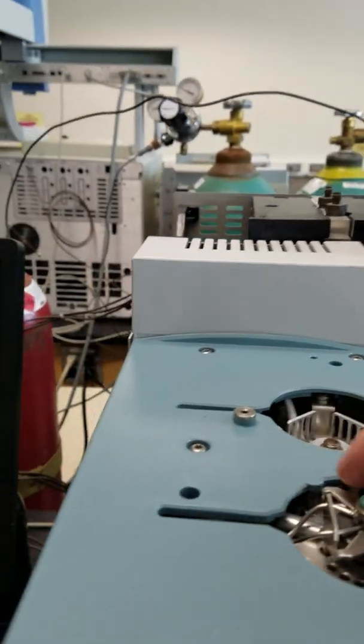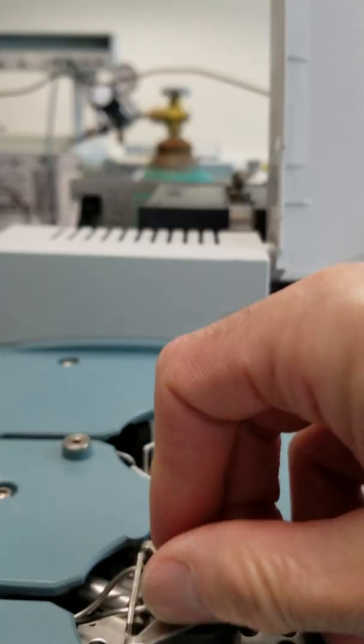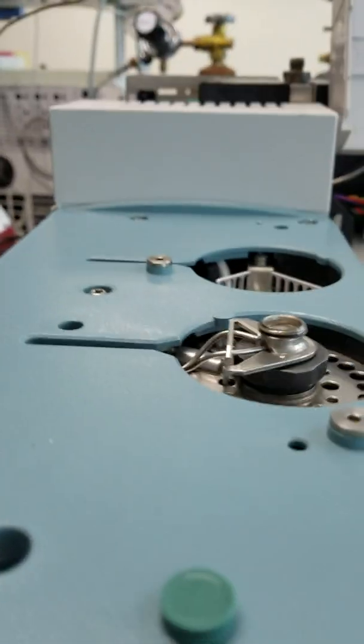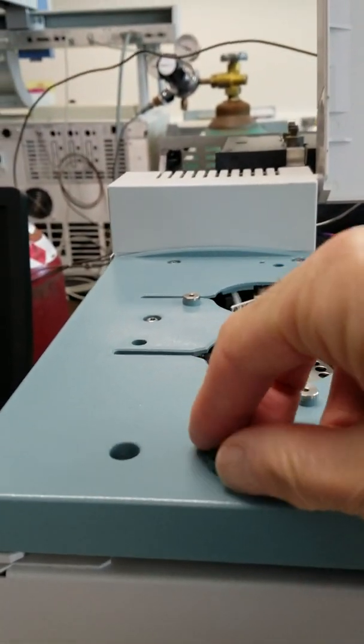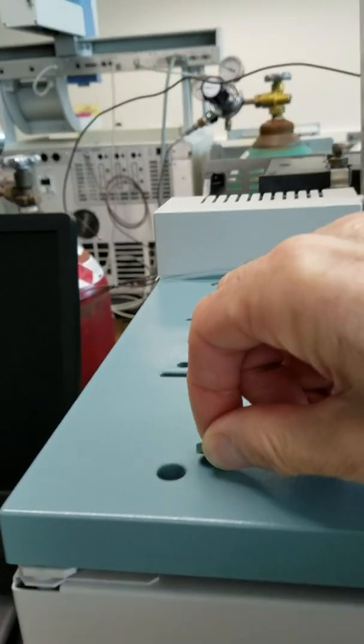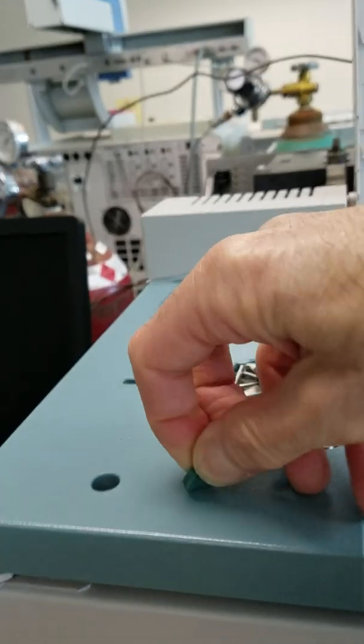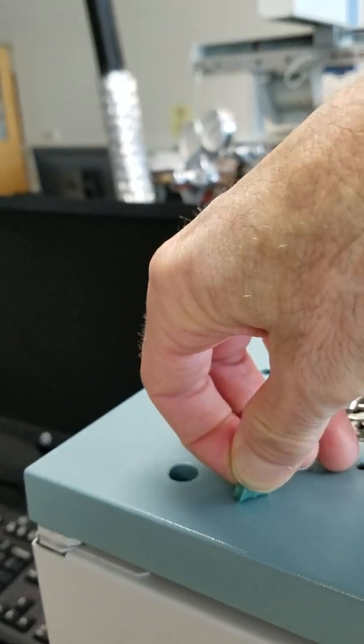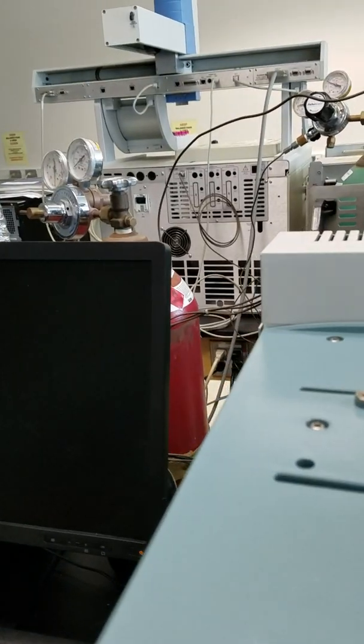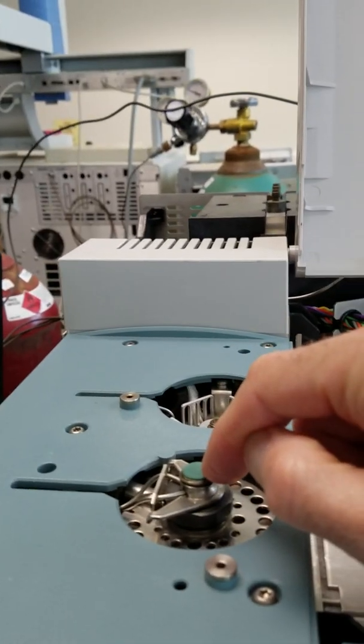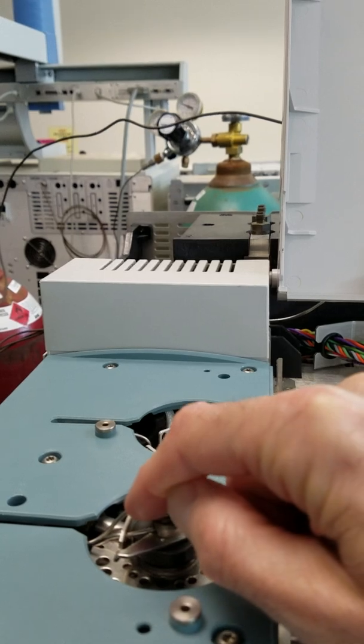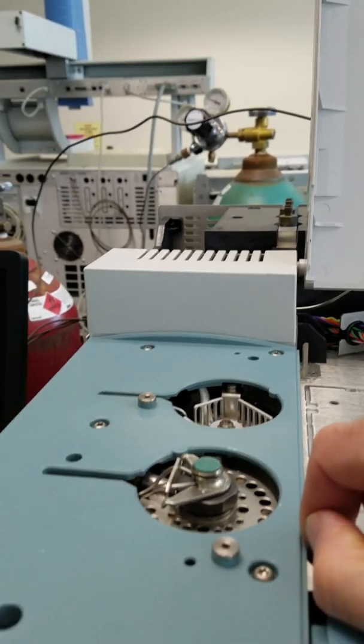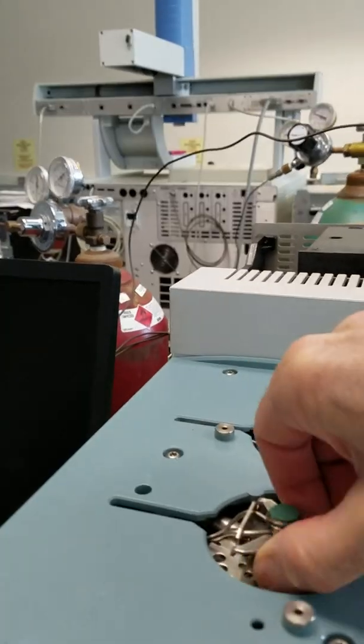This is the septa that we talked about or mentioned. Right there, that little piece is a septum. It's fairly soft. The whole purpose of this is that when you puncture through it with a needle, it will reseal and your injector will stay sealed. You won't get air going into it.